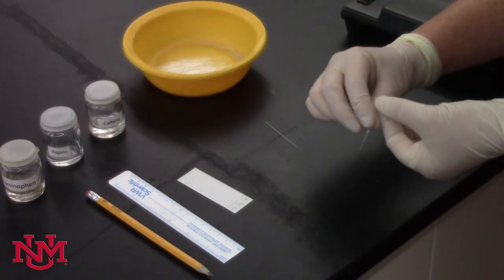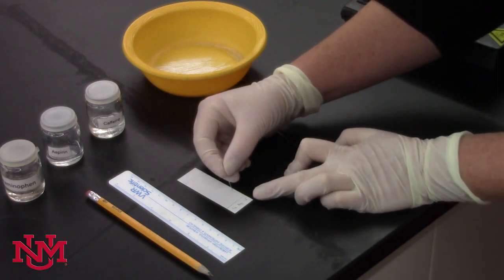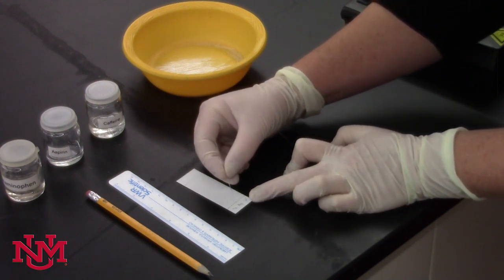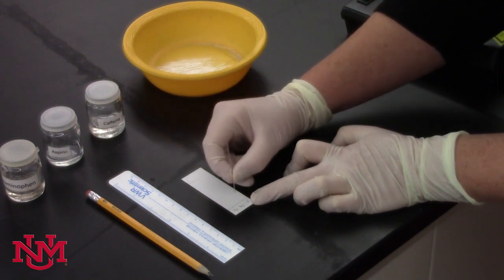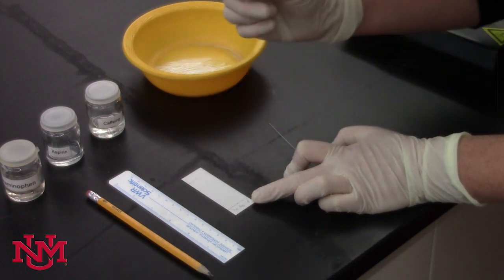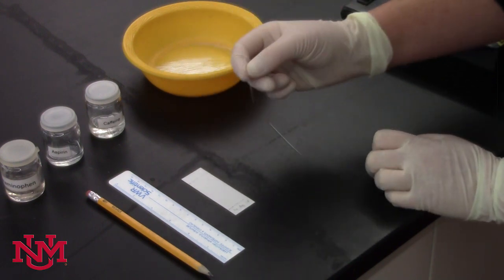Once you move that out of the way, repeat the same process by touching the end of the capillary to the aspirin dot. Try not to touch other parts of the TLC plate and try to draw the spotter directly to the pencil dot labeled aspirin.